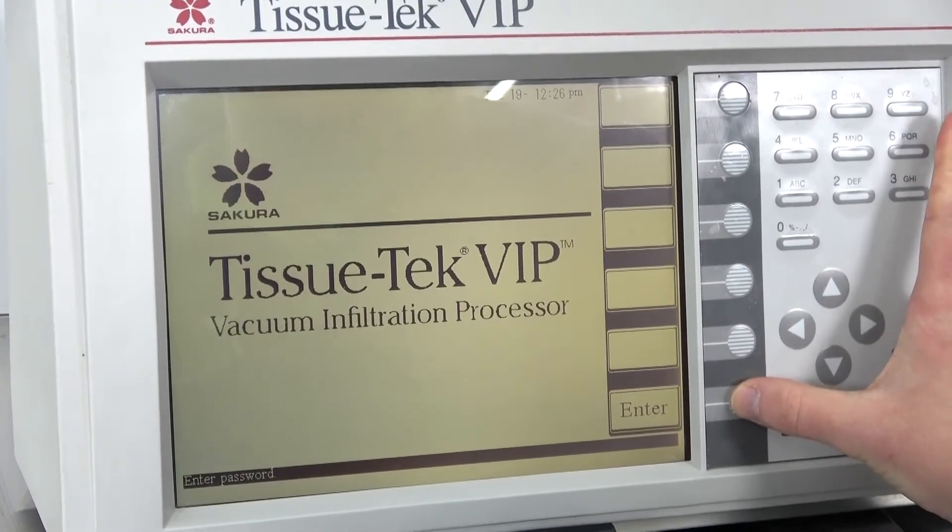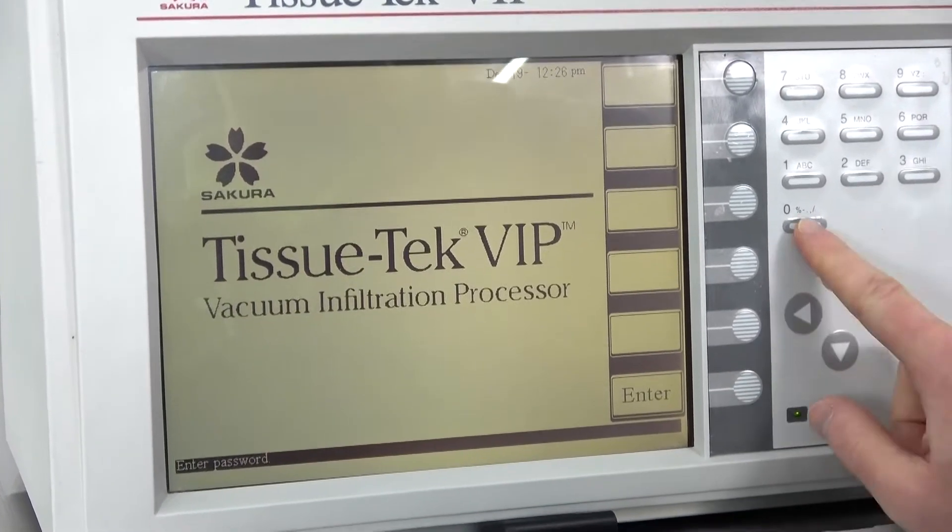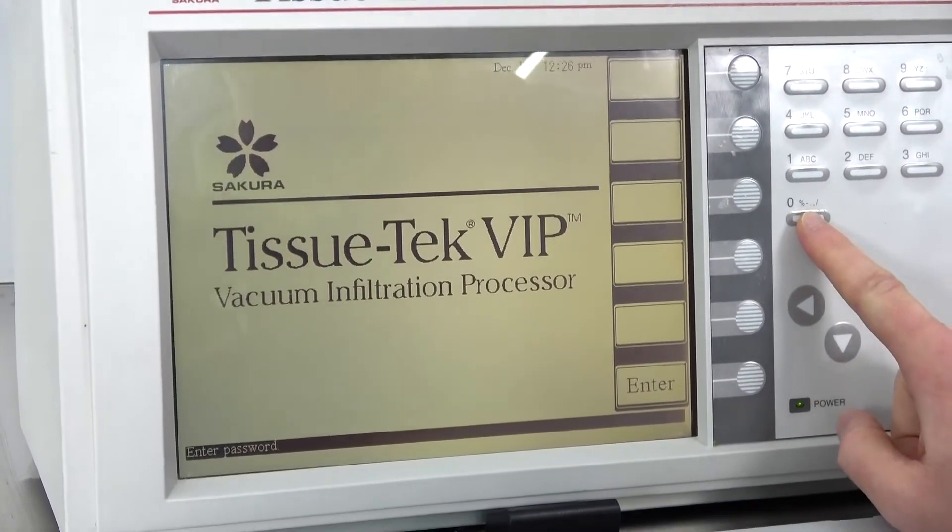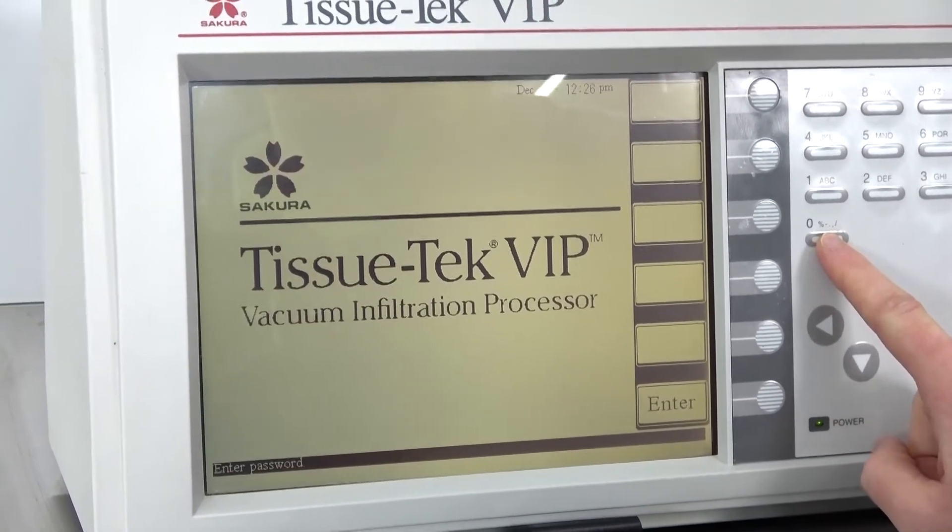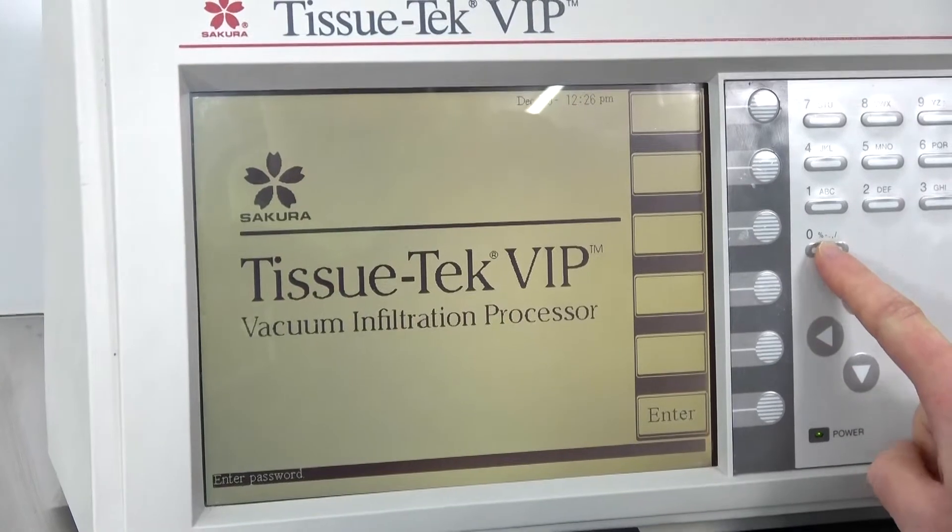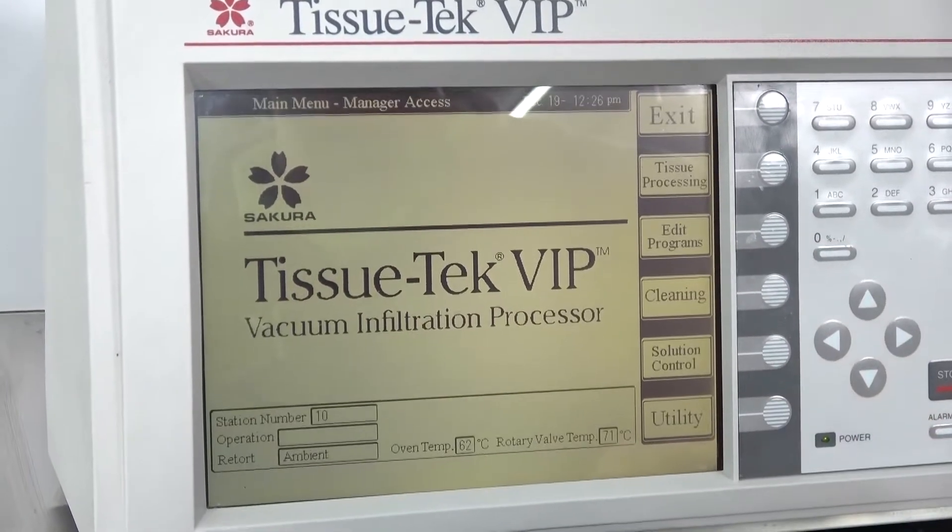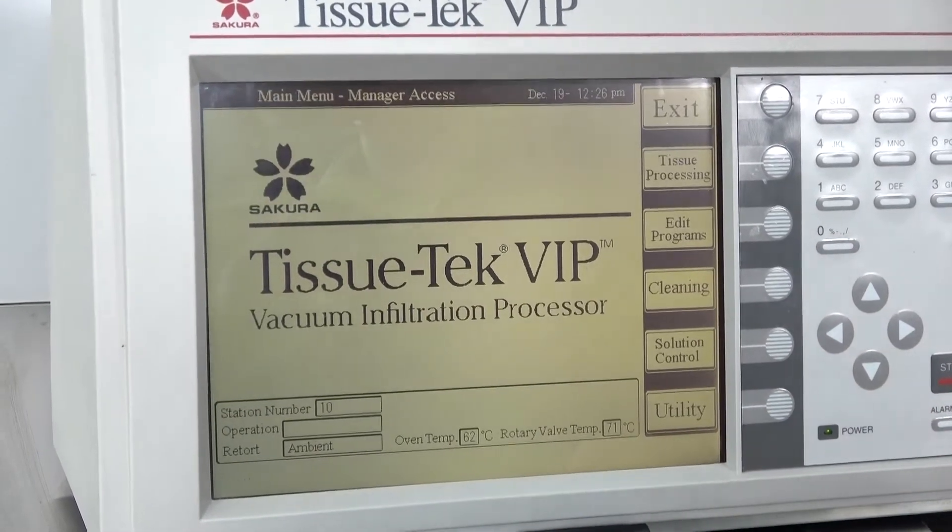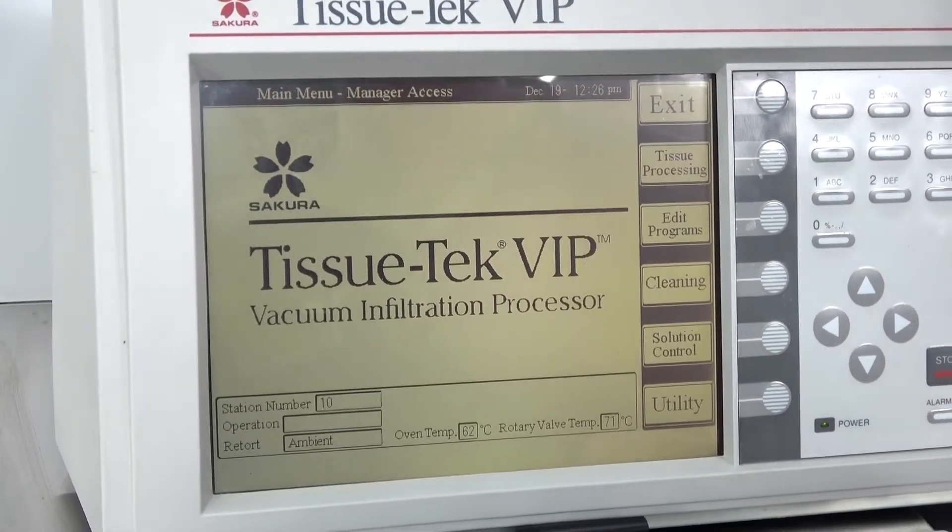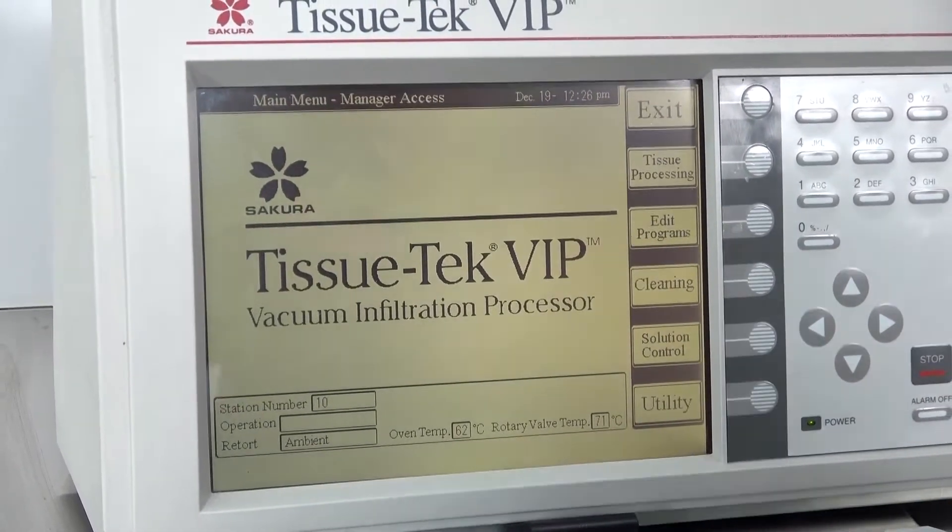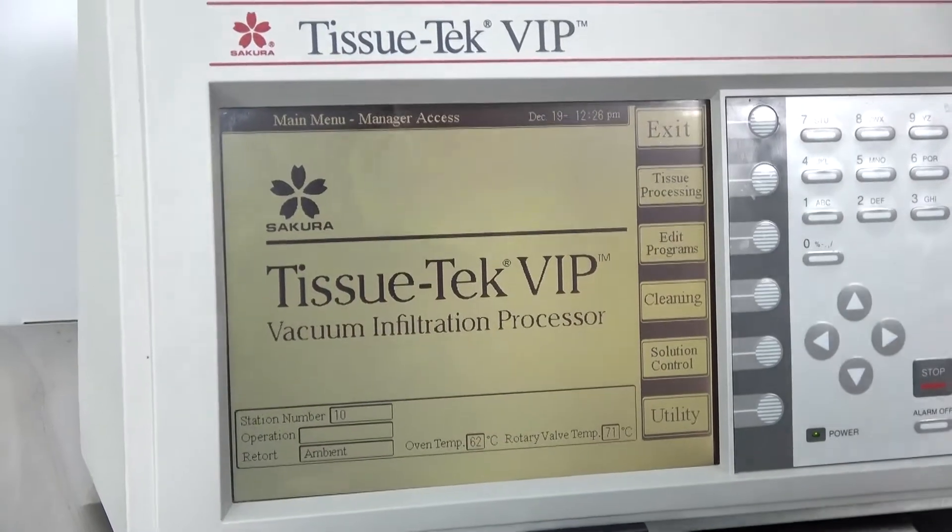For those that get this, do know the password is a really difficult 0000. So yeah, as Steve said, I'm in the club. Now you are too.